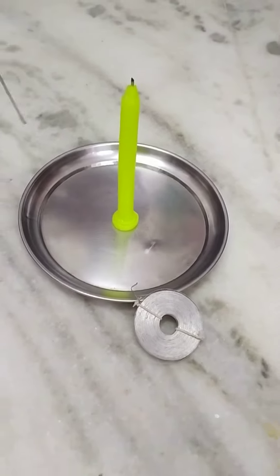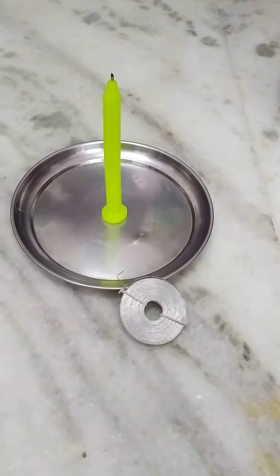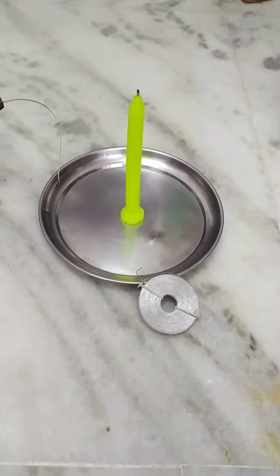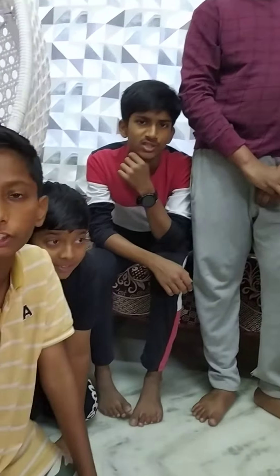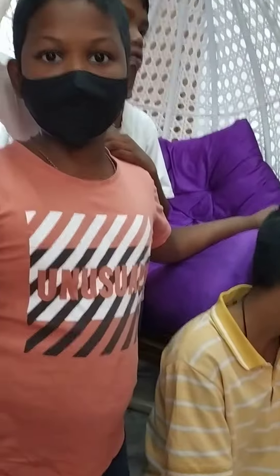Today's experiment is finding and checking the nature of metal oxide. What is the nature of metal oxide? That we will test today.